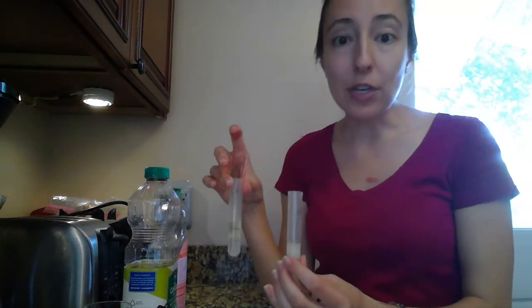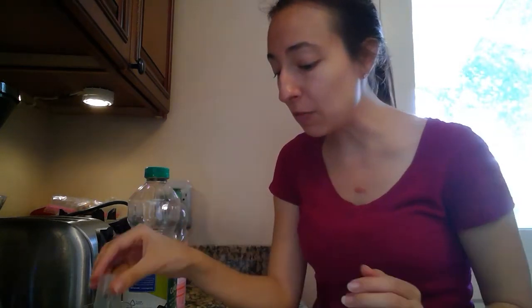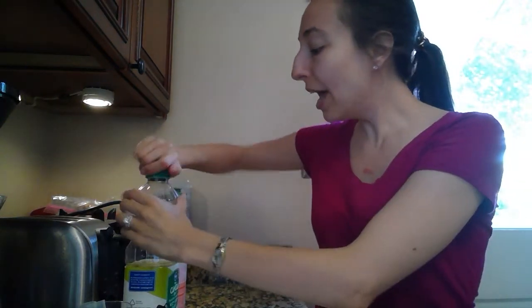Going down to number 5. We're going to go into a slightly different experiment now involving whipping cream, okay? So once you finish up with your test tubes and you've recorded your different observations on what they look like, you can go ahead and clean that up. You want to make sure to rinse out your test tubes really well, save them for any future uses. If you used your pipette, again, make sure to suck water up into it quite a few times to rinse out the inside so that it's usable again in the future. And we're finished with our oil and our soap, so you can go ahead and put that away.